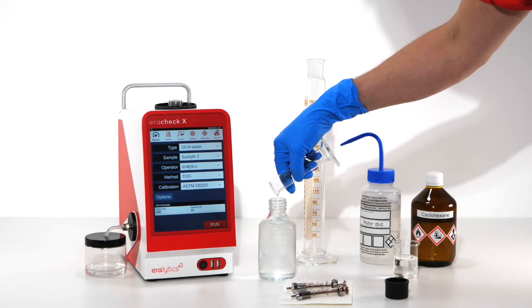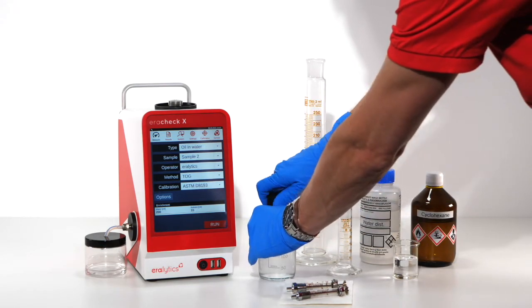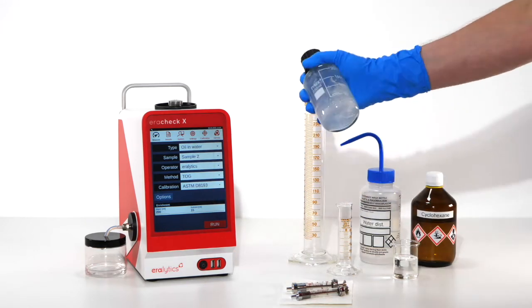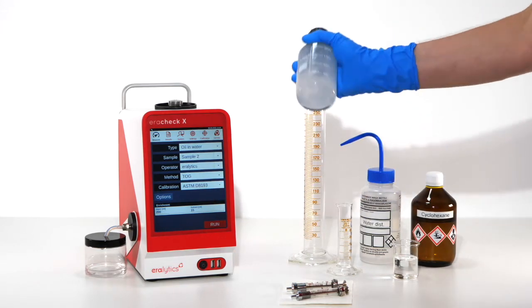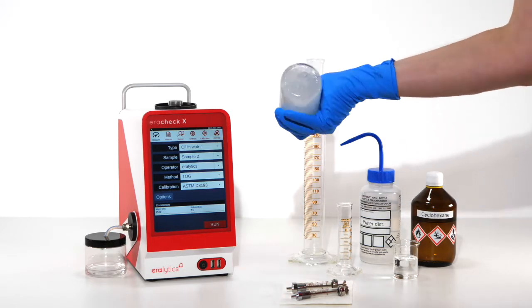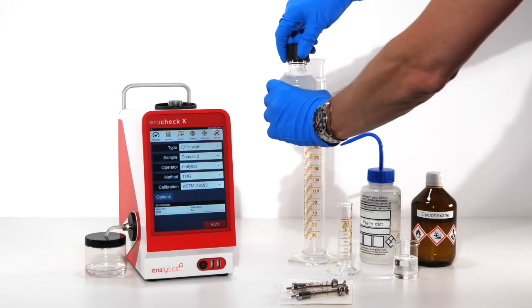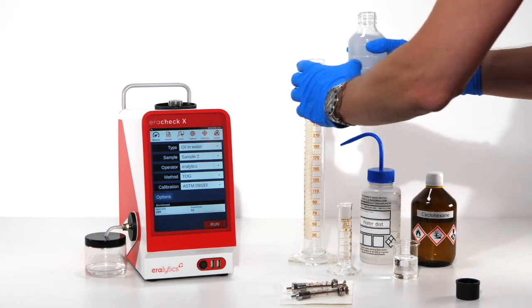And shake the bottle vigorously for one minute. Immediately transfer the emulsion into the graduated sample cylinder.